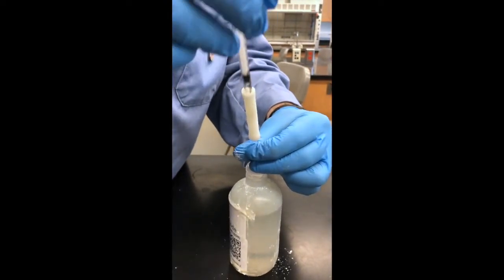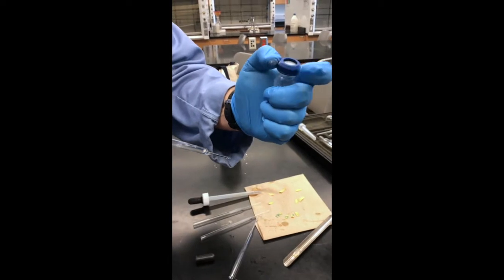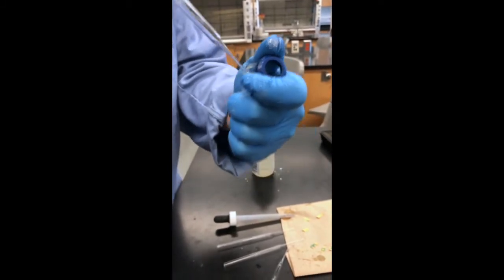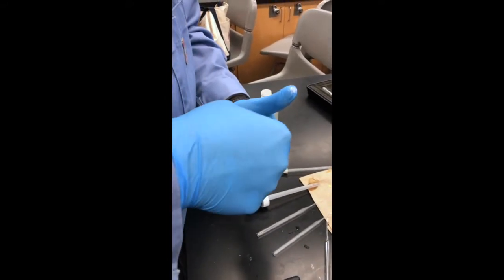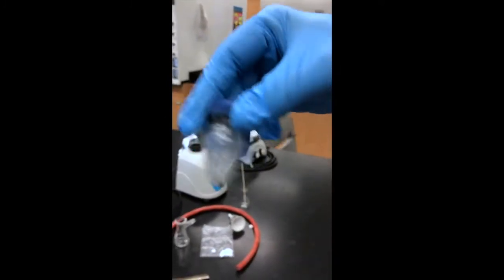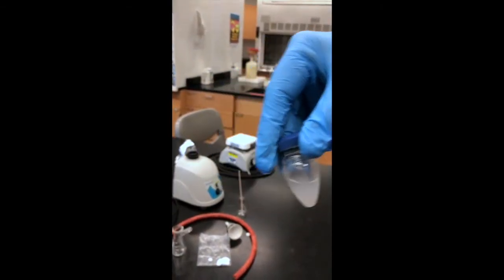The next increment is another 0.4 milliliters of the 6 molar sodium hydroxide, which we added once the pH was acidic, or below 7. So we open the cap, add it in, and quickly cap it back up. Making sure the cap is in place properly, shaking the solution a little more. The solution has gone a little cloudy at this point. Most of the oil drops seem to be gone.